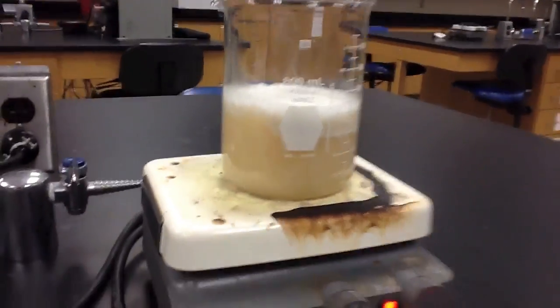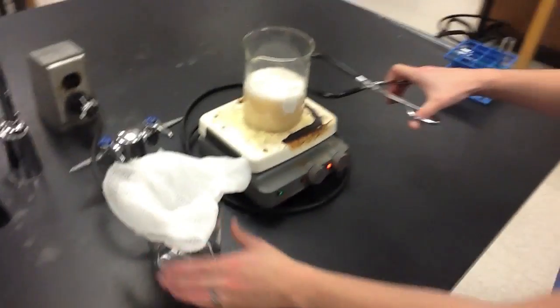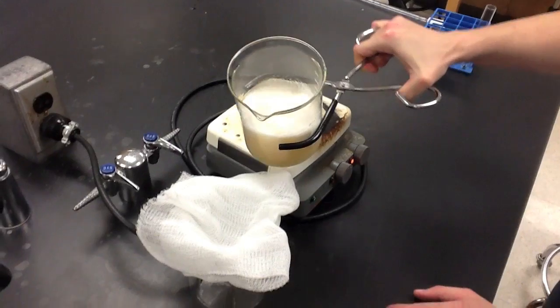Once boiling was complete, we then strained the mixture to remove any larger pieces of banana debris.